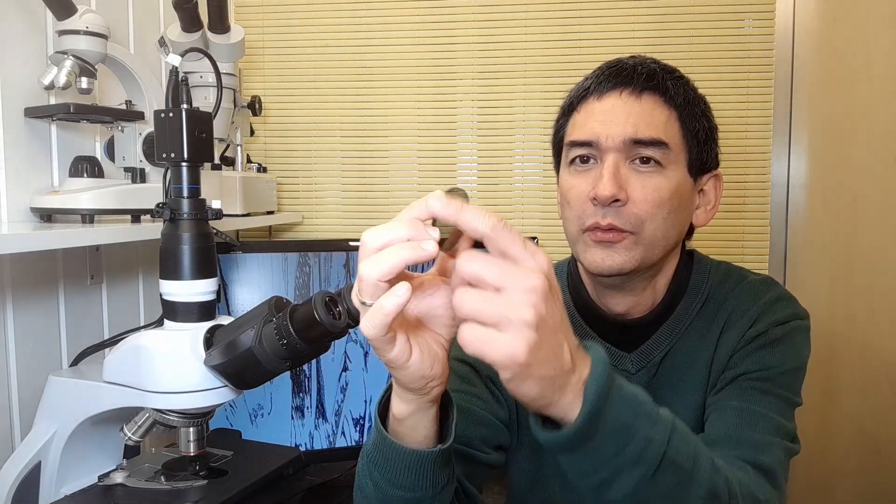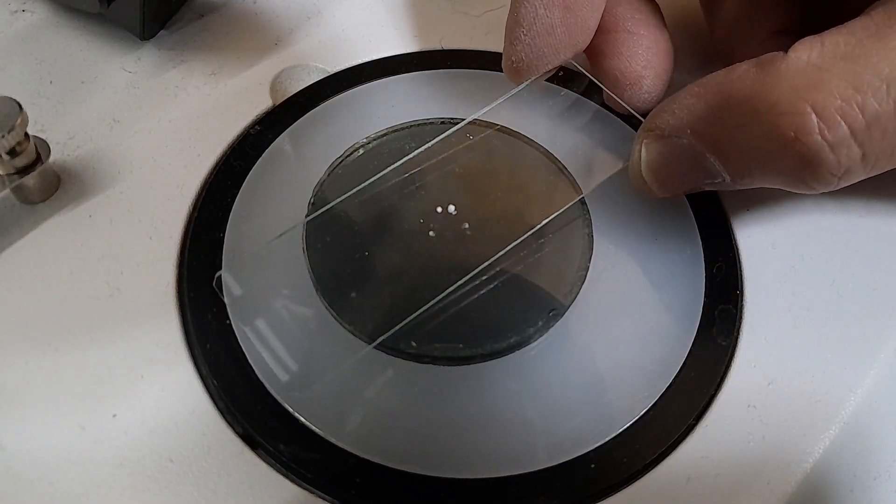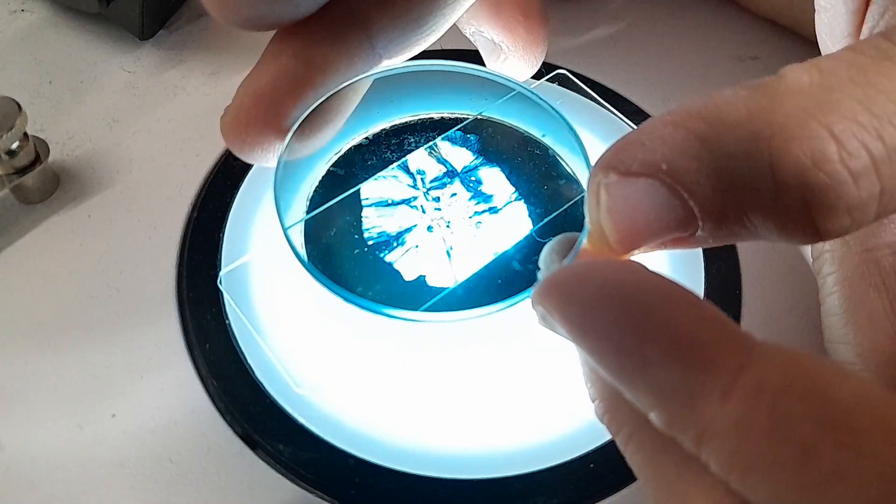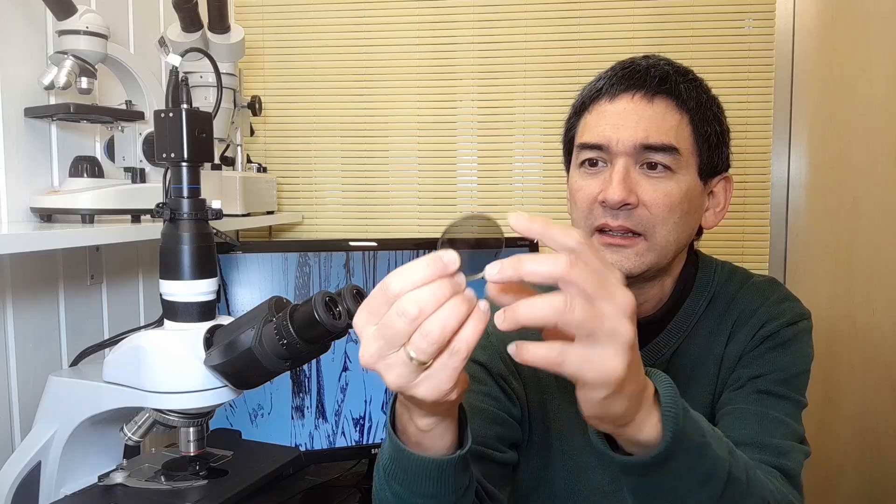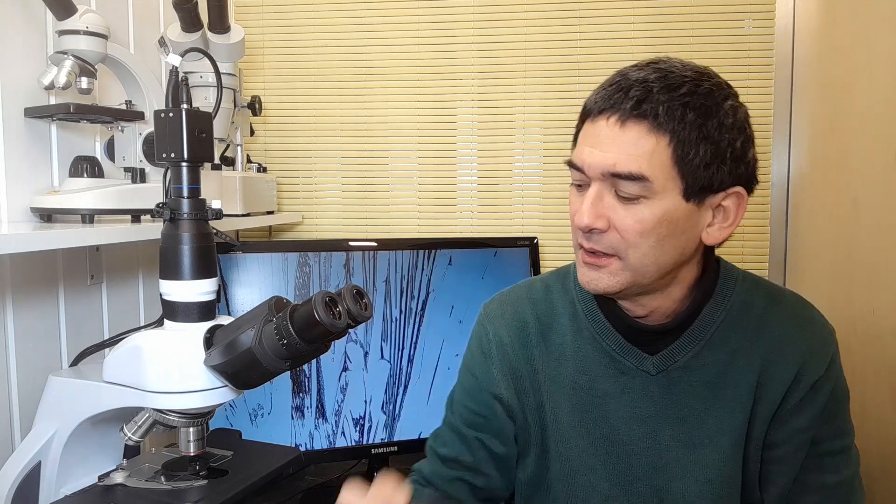I once bought several years ago those glass filters and they basically can be put on to DSLR cameras. I kind of removed the ring here and they also work, but I would say probably they're a little bit too expensive. They do not have any significant advantages either, but essentially they're nice and solid and handling is much easier than the plastic films that you can buy. And now I'm putting them back again here over the lamp.